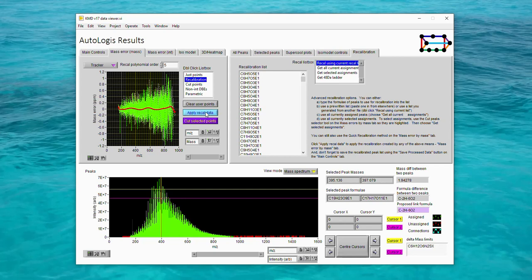While that recalibration is being applied, it's worth remembering that these types of localized mass recalibration issues can be caused by the ion density in the instrument or the mode of use of certain designs of mass spectrometer. Because in this case we're applying Tracker mode after the gross polynomial correction, we don't see a huge difference in the data, but it has had an effect. The final mode we'll look at just now is Walker mode. Walker mode is a walking style recalibration method that looks for much shorter scale mass recalibration issues in the data.